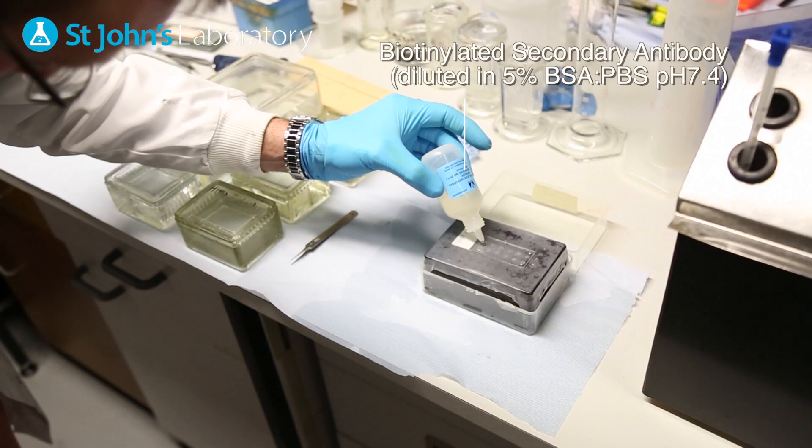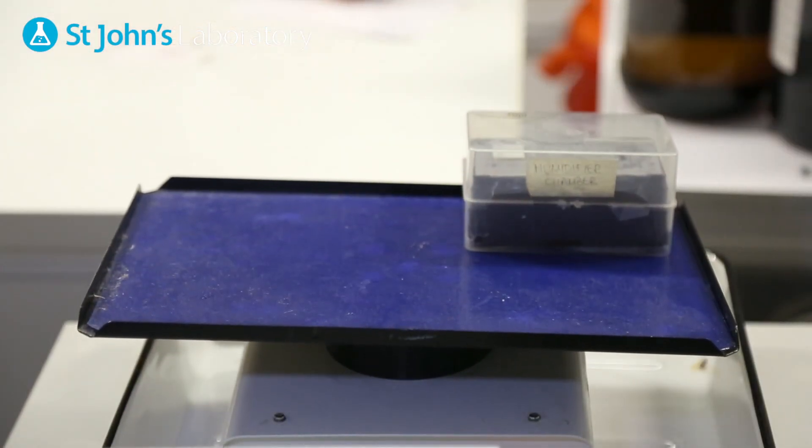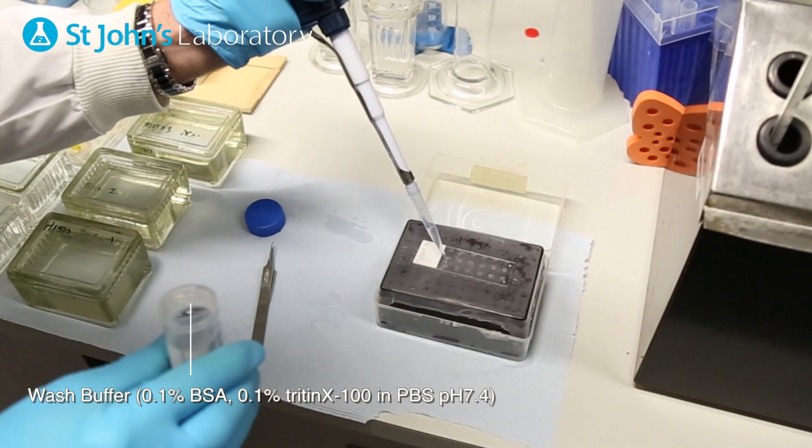Apply your secondary antibody at the appropriate dilution and incubate the slide for up to one hour. Following this step, repeat the wash phase again.